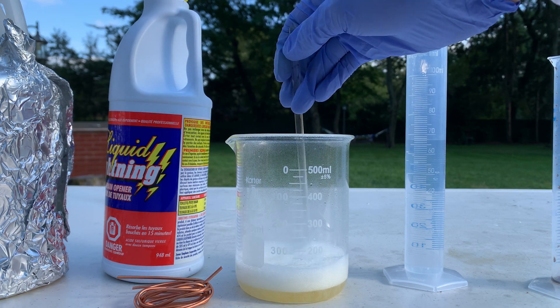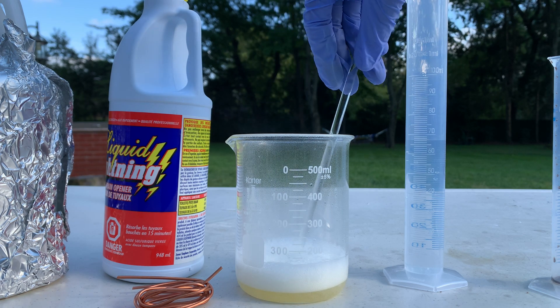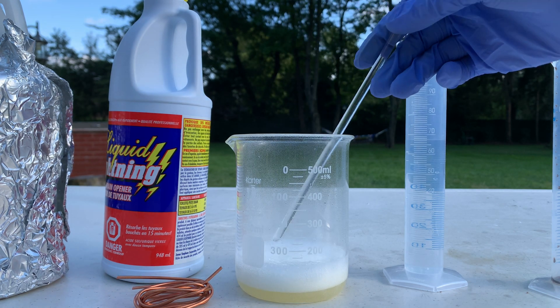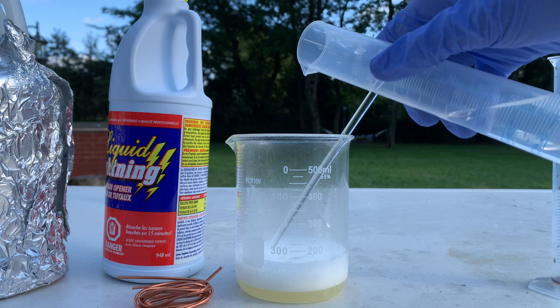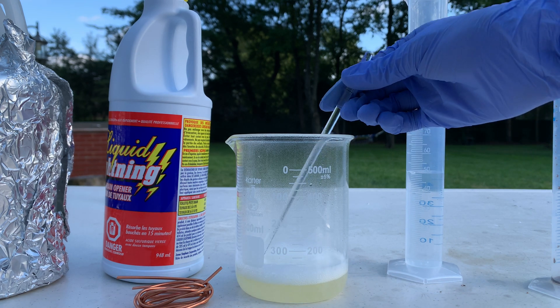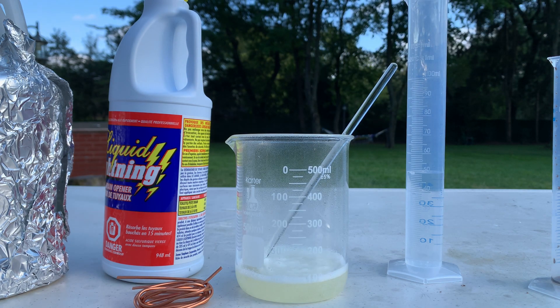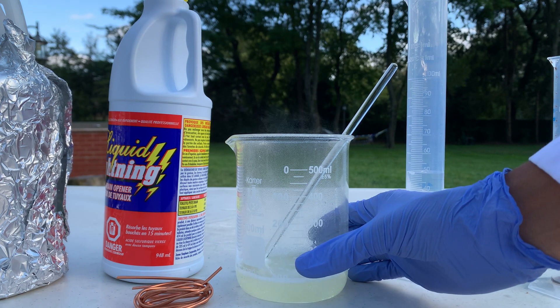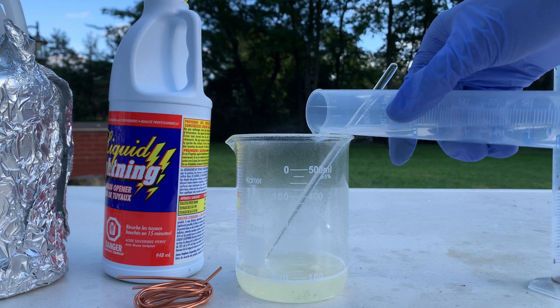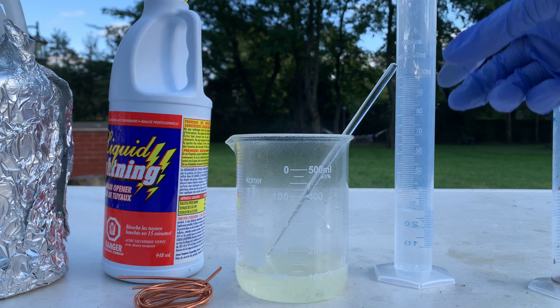There's a lot of foam being produced, so I'm going to wait for this foam to settle down before I add any more hydrogen peroxide. I still have around 65 milliliters of hydrogen peroxide to go. Let's add a bit more. This smells really bad. The solution is boiling hot. Almost there — 25 milliliters of hydrogen peroxide to go.